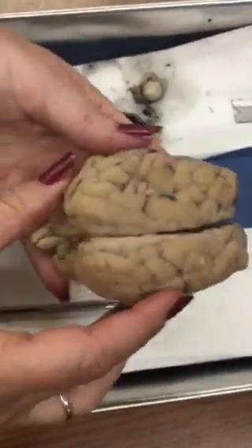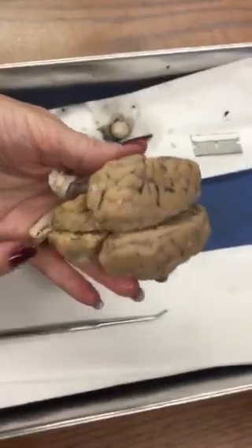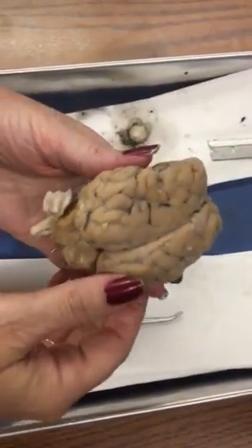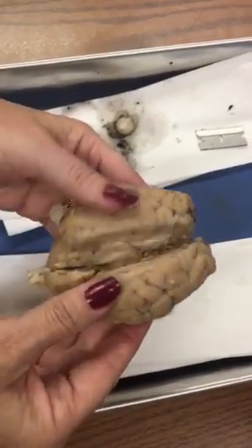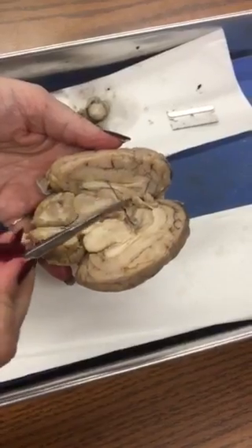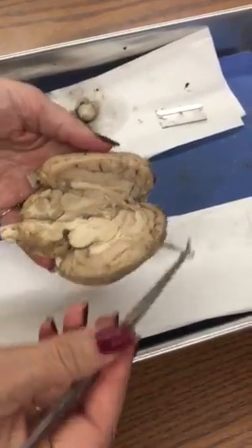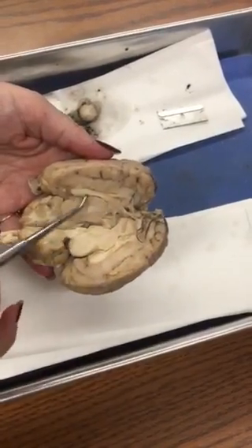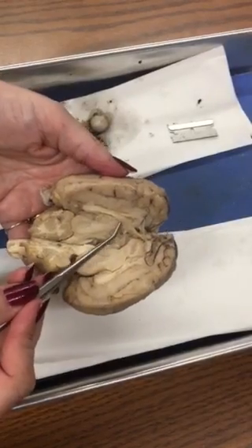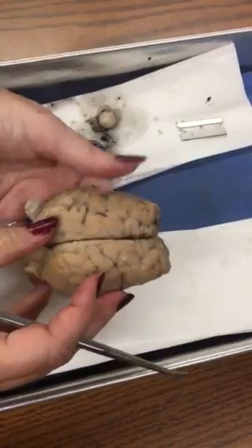Brain, there are 4 parts to it. This whole thing is the cerebrum, cerebellum, brainstem. The 4th part we can't see until we open it, which is the diencephalon. That's kind of like that Nike swish shaped region right there. There's 4 parts to the diencephalon. I'm not going to point out the parts, but you should know the thalamus, the hypothalamus, the epithalamus, and the pineal gland. Okay, so those are the parts.